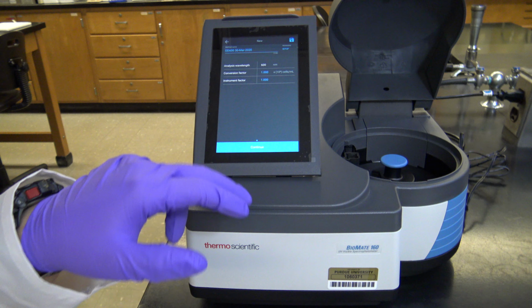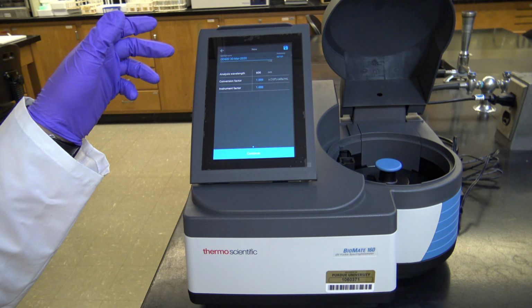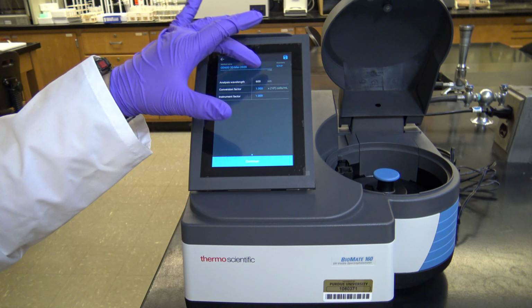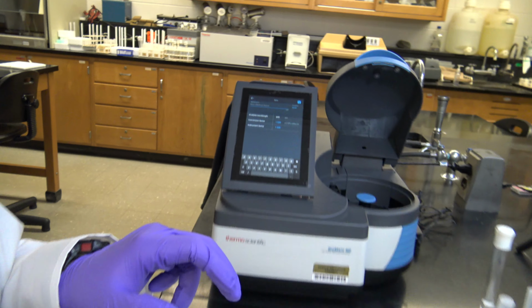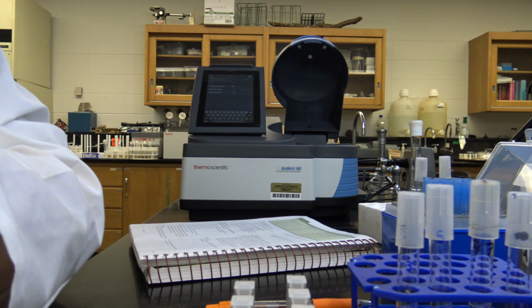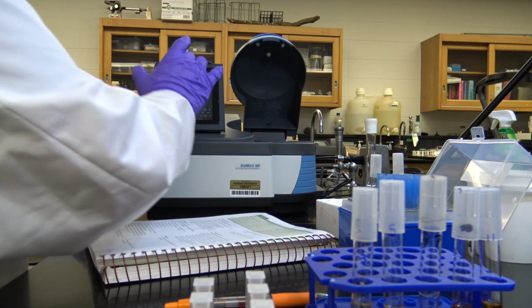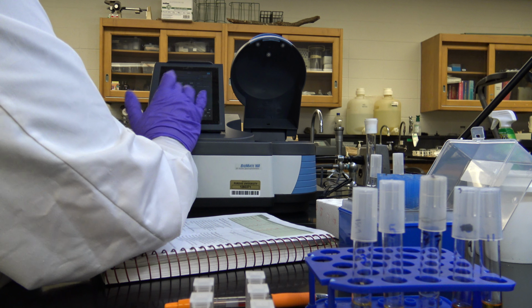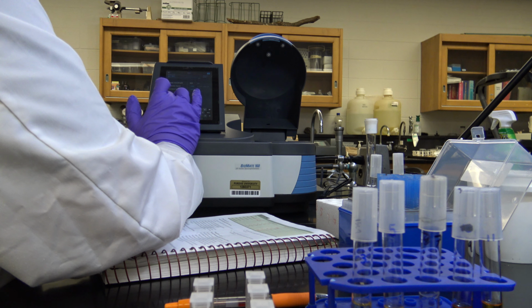I'm going to hit the plus, and then I'm going to create a new session, right? So we'll go ahead and name this one real quick here. Let me set you down while I name it. I'm going to name this one 22.1 because that's what we're working on, right? So 22.1, and we'll go ahead and go Bio 102.